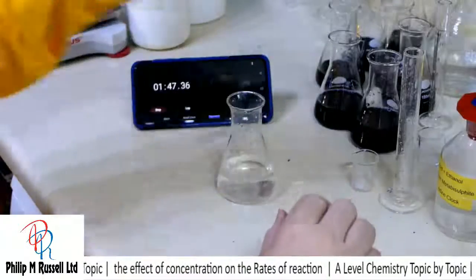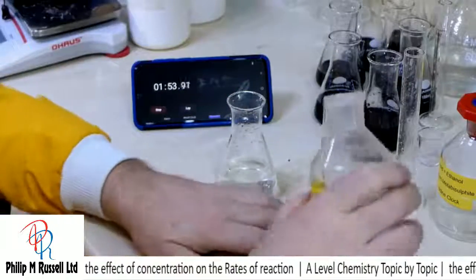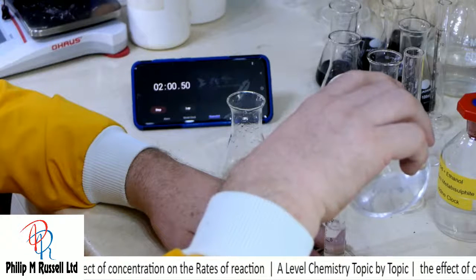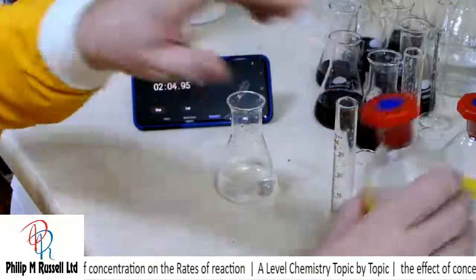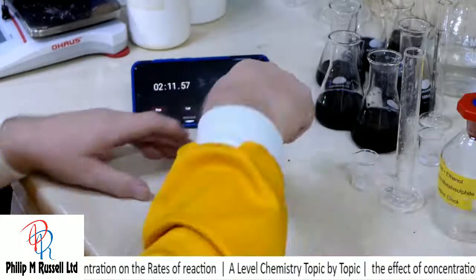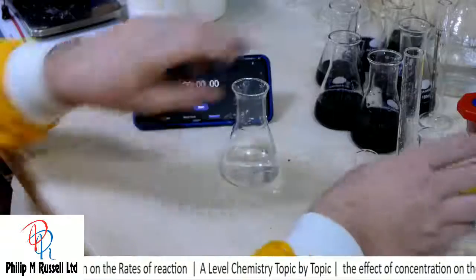Small amount of indicator, and we'll do our 10 mils of this. Let's reset the stopwatch.